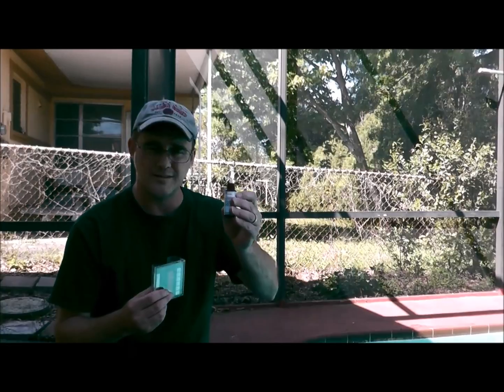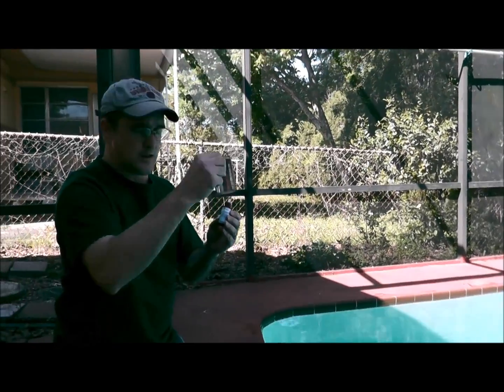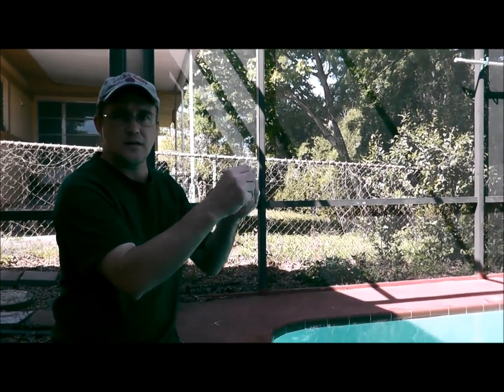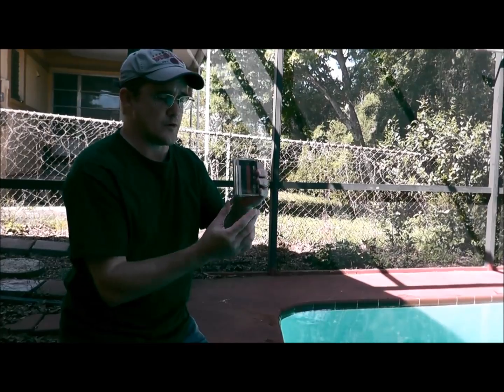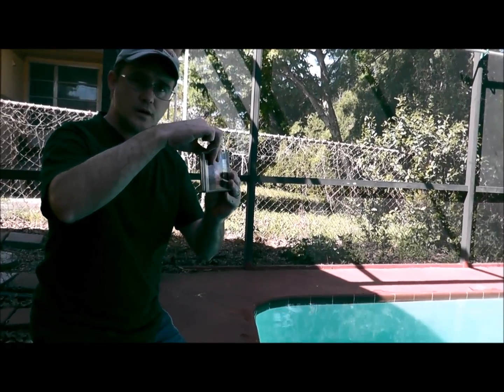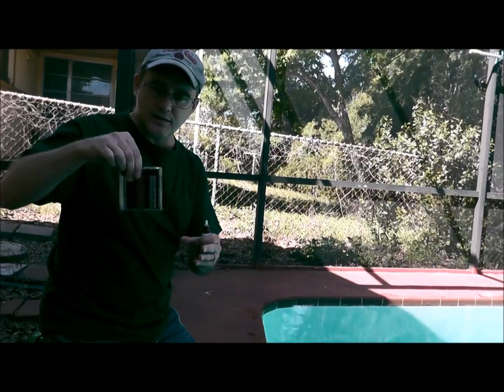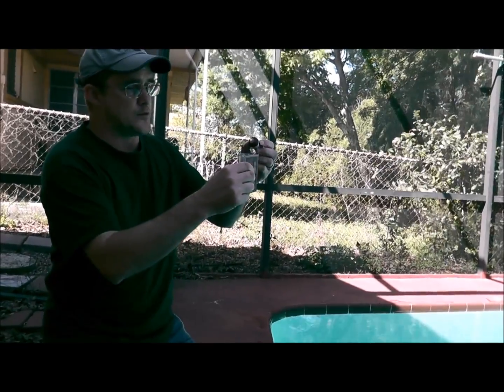Then take your brown bottle — this is R0871. Hold it right at eye level; you don't want to hold it down low. You also want to get a full dropper, holding it straight up and down, not to the side. The swirling technique is really important: you don't hold it down here and slosh it back and forth, and you don't hold it up high and go back and forth either. You want a good circular swirl — it looks like back and forth but it's actually going in a circle.